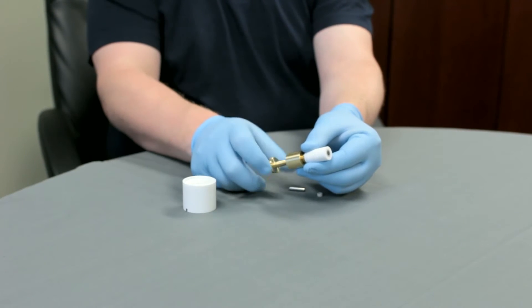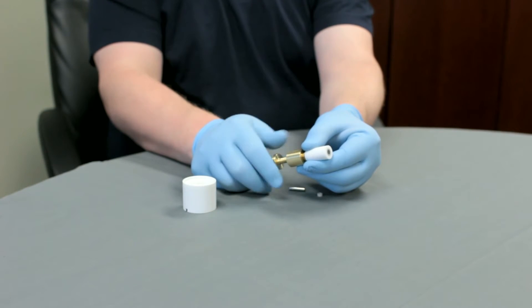Now turn the screw slowly until the disk core assembly is pushed out and fully disengaged from the tip body.